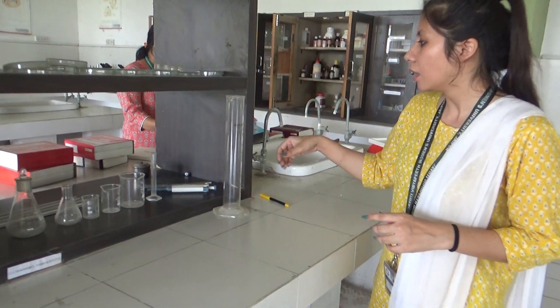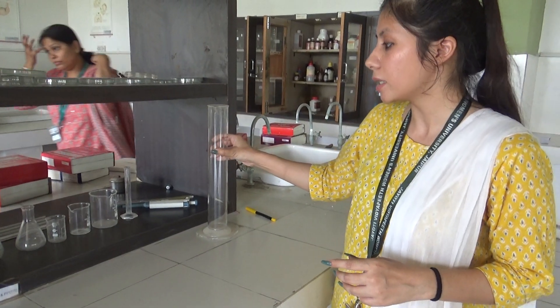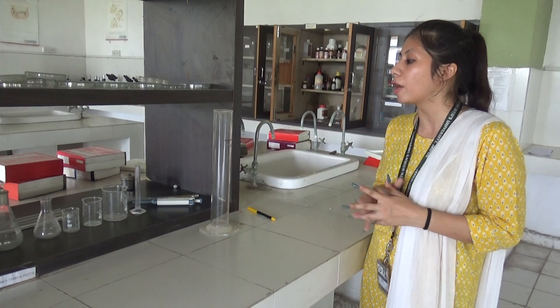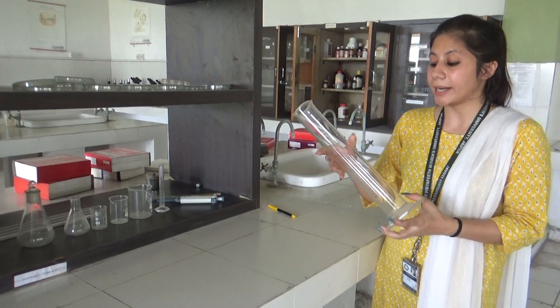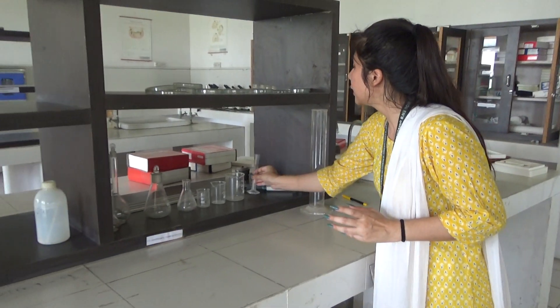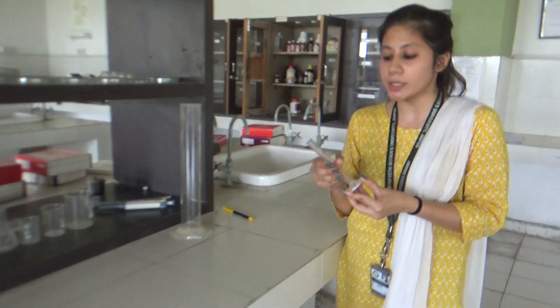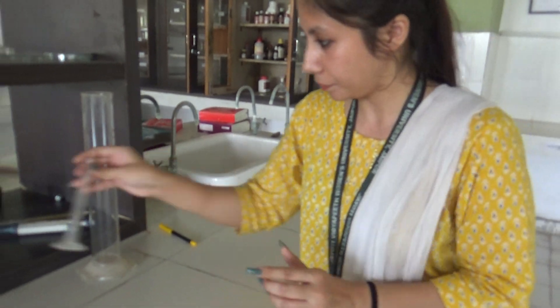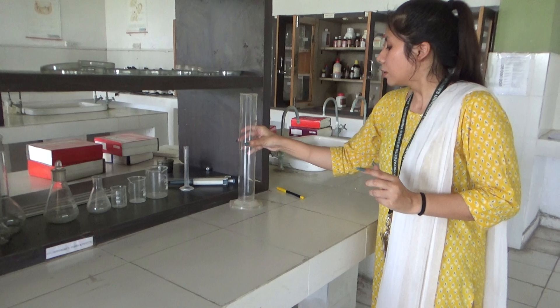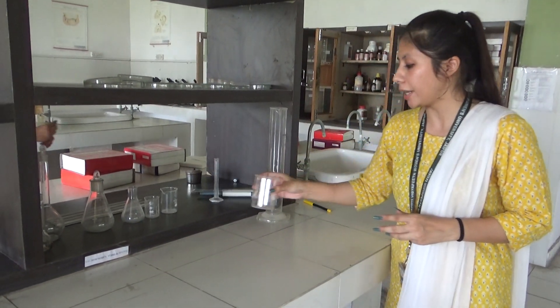First, these are measuring cylinders that are available in different sizes. These are 500 ml measuring cylinders that are cylindrical in shape. These are another set available in another size, that is 10 ml. They are used for measuring liquid solutions in the laboratory.